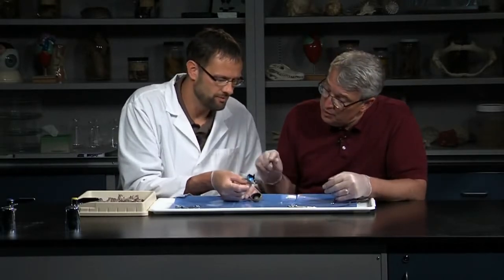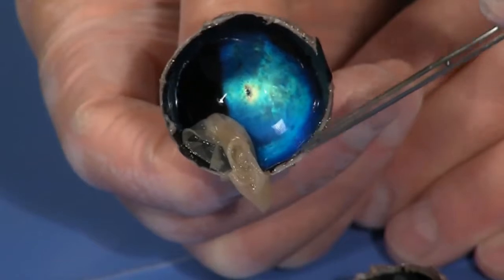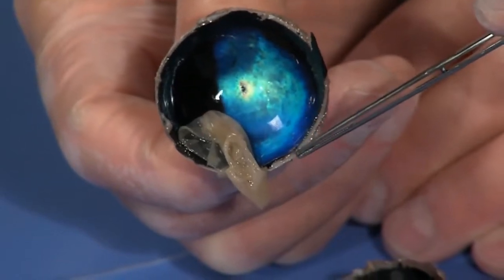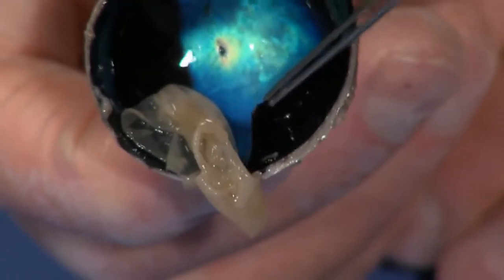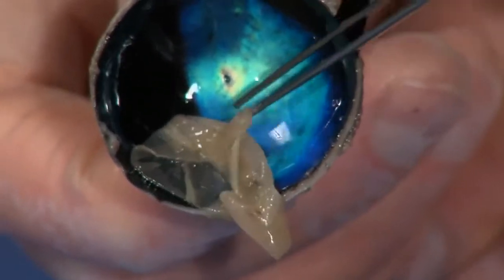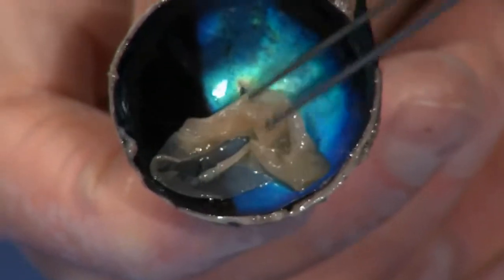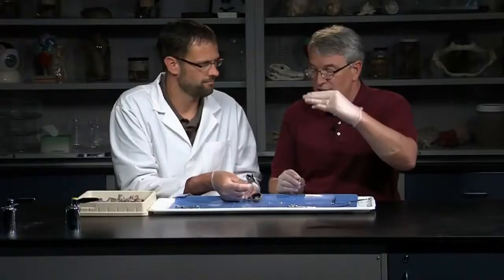You can see the scleral coat on the outside — it's tough. Then the choroid, the next layer in. And the innermost layer is the retina. So from outside to inside: sclera, choroid, retina.